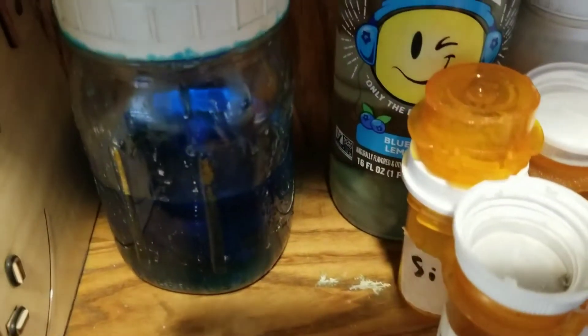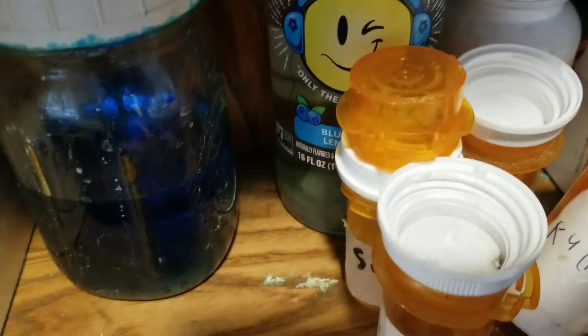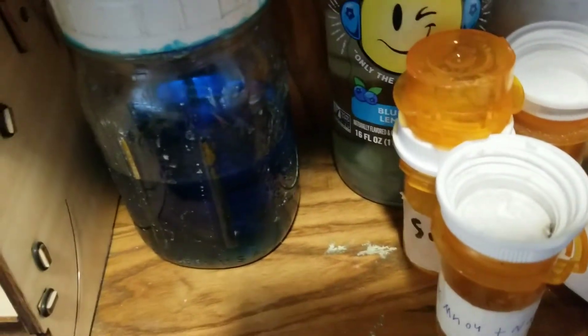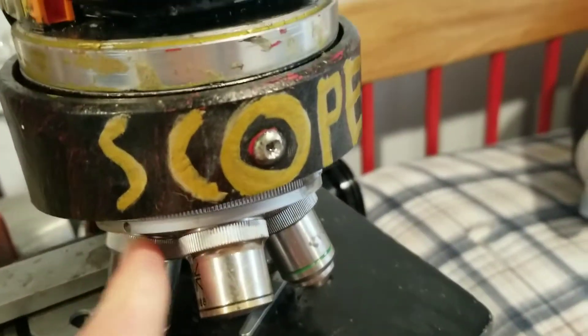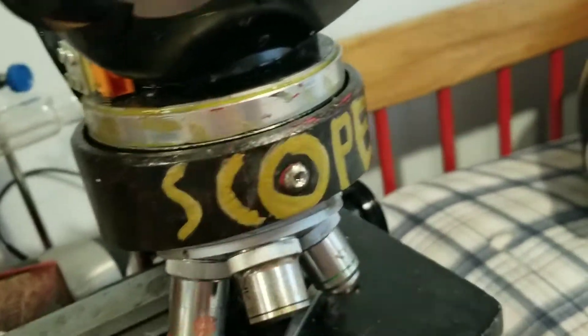Copper sulfate, salt, and sugar are all soluble in water, which makes it very easy to grow crystals from them. However, calcite — calcium carbonate — is non-soluble in water, and it crashes out of solution into a very fine powder of microscopic crystals whenever you try to perform a chemical reaction to synthesize it. If I want to create a wave plate for my microscope, I'm going to need a crystal at least the size of my pinky fingernail.